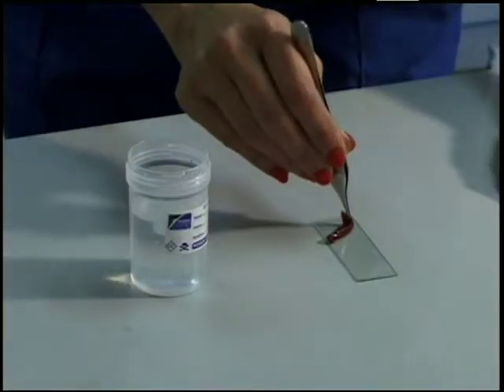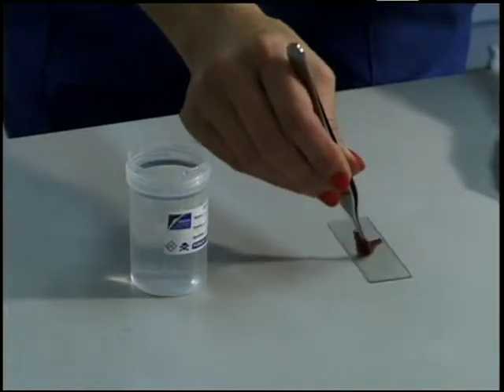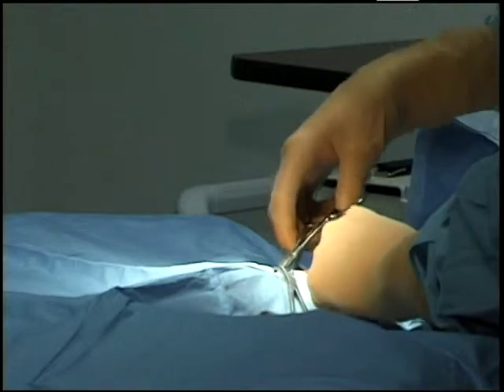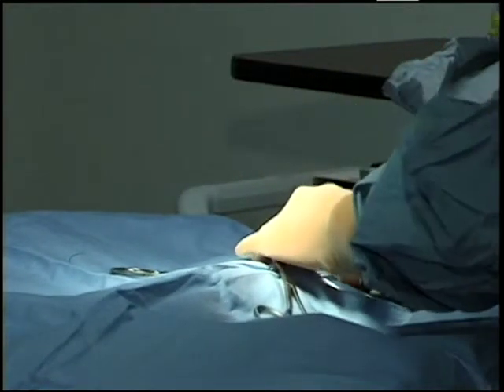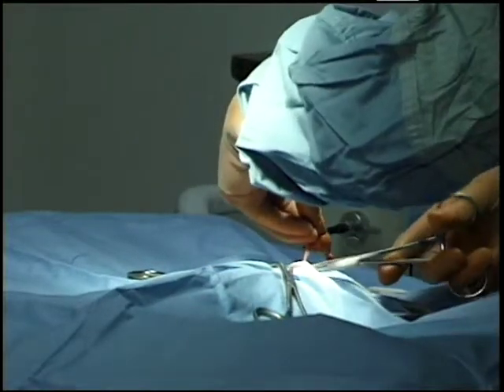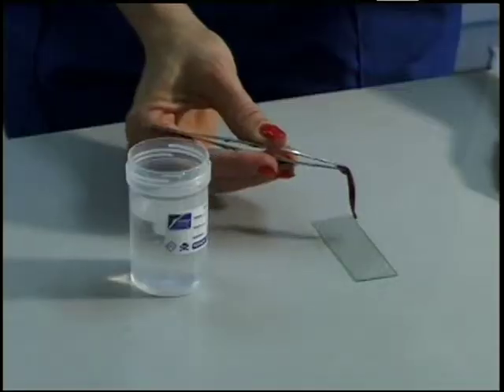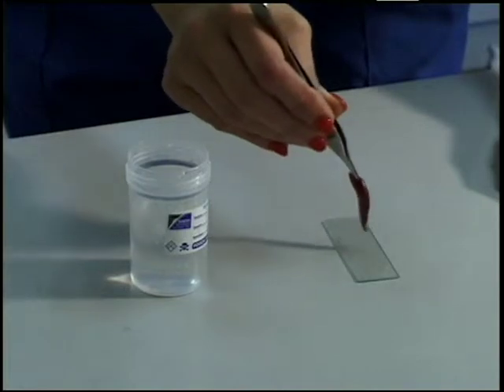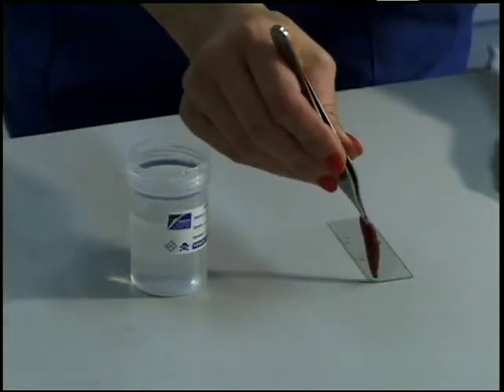Impression smears are another means of getting the suspect cells onto a microscope slide. This technique is commonly used when cytology of a surgically excised mass is needed. A fresh cut surface of the mass is generally preferred. This surface should be first blotted lightly with a paper towel to absorb blood and other fluids. The surface is then lightly pressed against the slide several times, causing cells to be deposited onto the slide. The sample can then be dried, fixed, and stained.